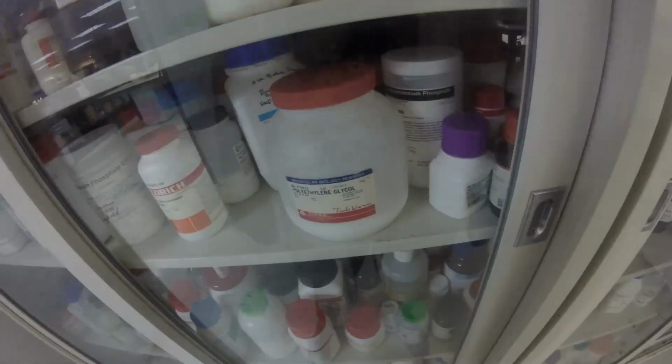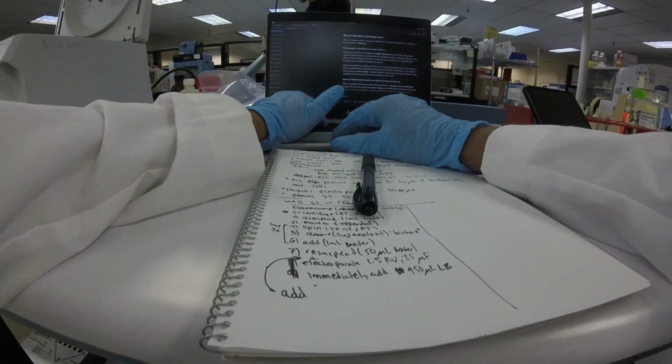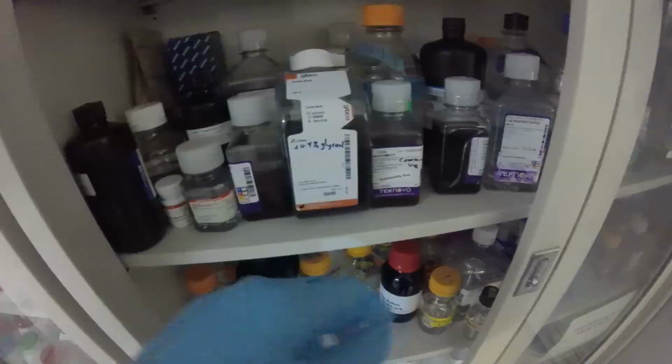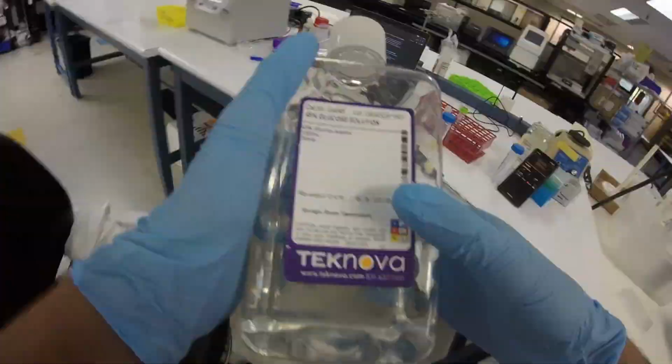I kind of wish it would have worked last night, but I'm choosing to think of it as a rite of passage, as everybody gets contamination at one point, and this is just a week into it. This is my first experience of having something go totally wrong and having to do it again. But it's just waiting for incubation that's so annoying, and I would like to know strategies to get around that. So here I'm making a 10% glycerol solution so that I can wash my cells in it. And then I was checking out the electroporator to see what I need to do. It looks really easy. It's an amazing device.